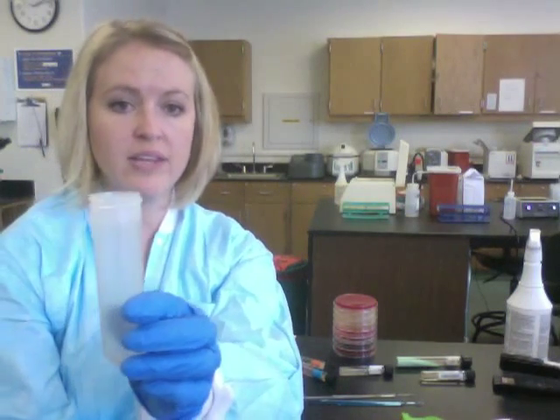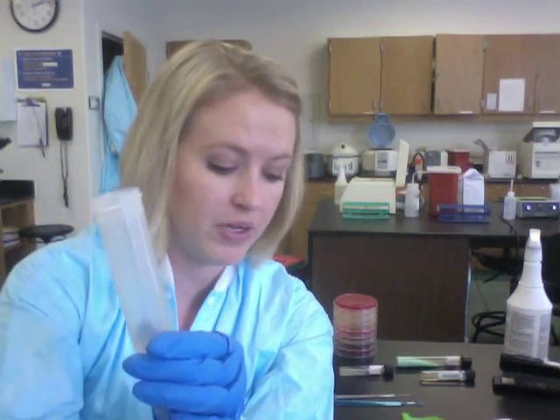When you are done, the tissue grinding cap comes off and goes into the biohazard bucket, so you are left with just the tube. Now you're going to take a sterile, disposable pipette, pipette up some of the tissue-juice mixture, and put it onto each plate that you need to inoculate.